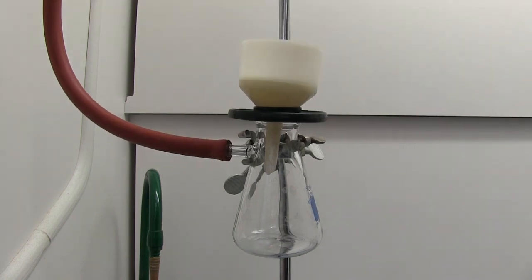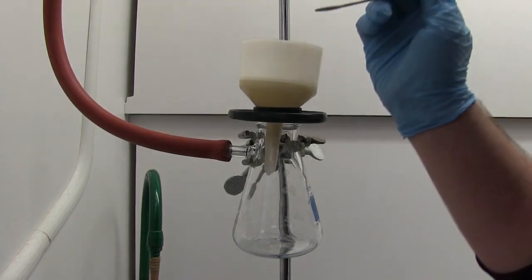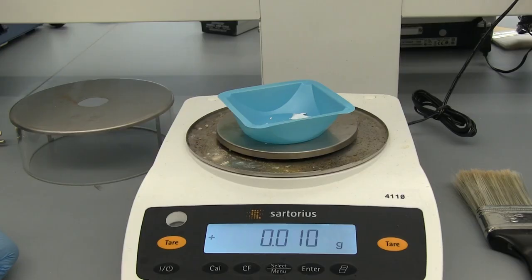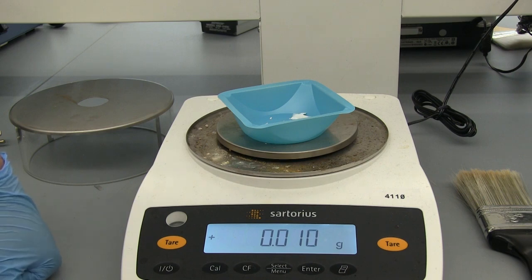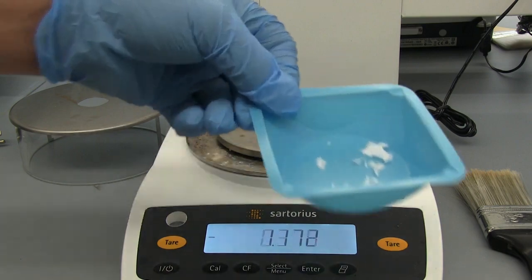Alright, so I'll let what I have dry and we'll see how much we get. We got our caffeine on the scale. It's been hovering about 12 to 8. When you're at this small a scale, these balances don't give you great amounts but let's go with an even 10 milligrams. But here is our caffeine.